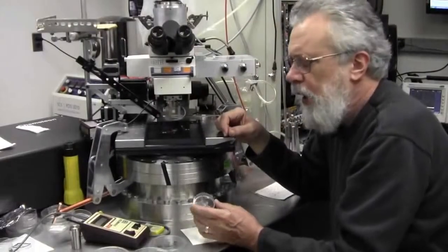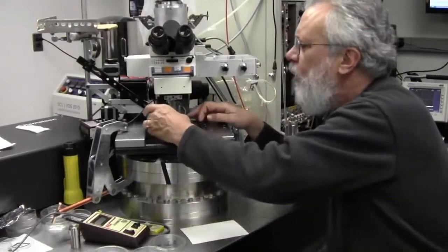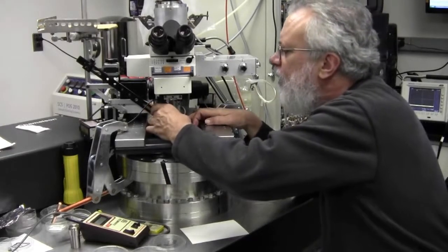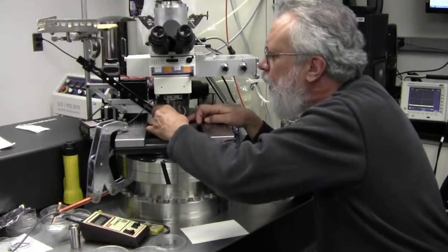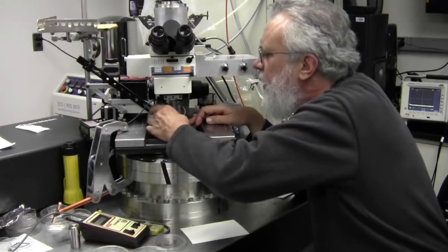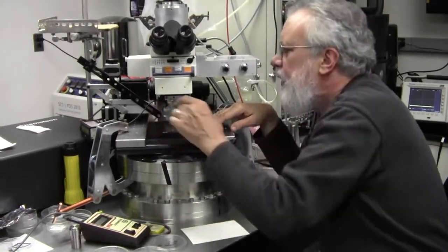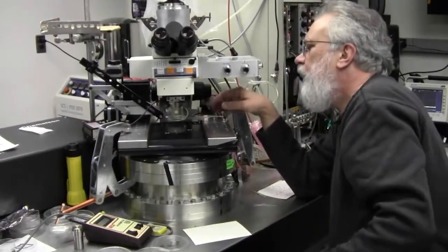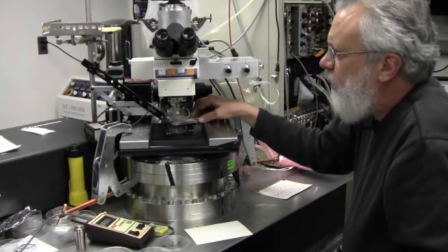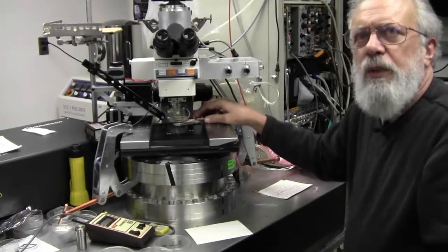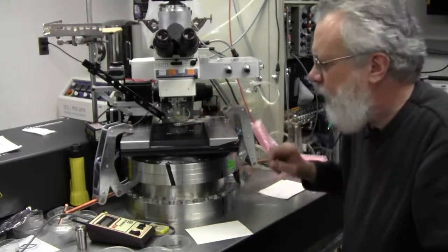I'll put it in place. Okay now we're going to put the knife edge over the exit of the radiator in the same position that the cells will take when they're being irradiated. And we'll put a detector in place over that to measure the particles to look at the energy of the particles.